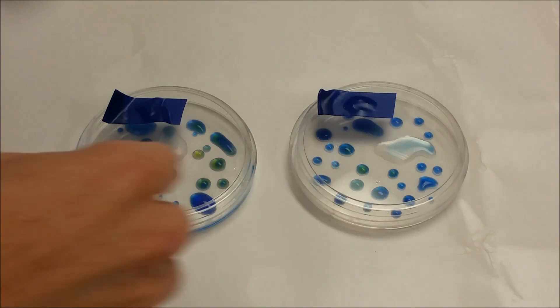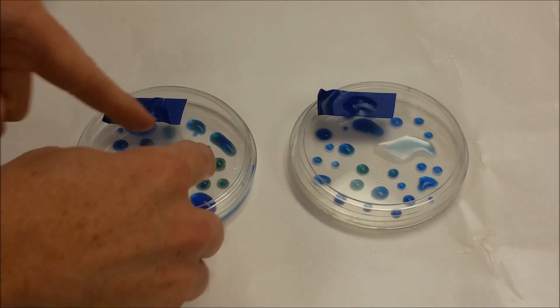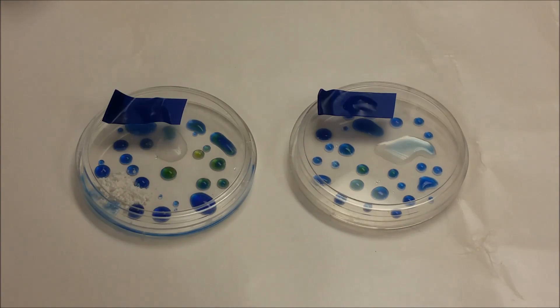And now we're pretty much all back at the basic form with these now transitioning to the green. Quickly they'll be back to the blue.